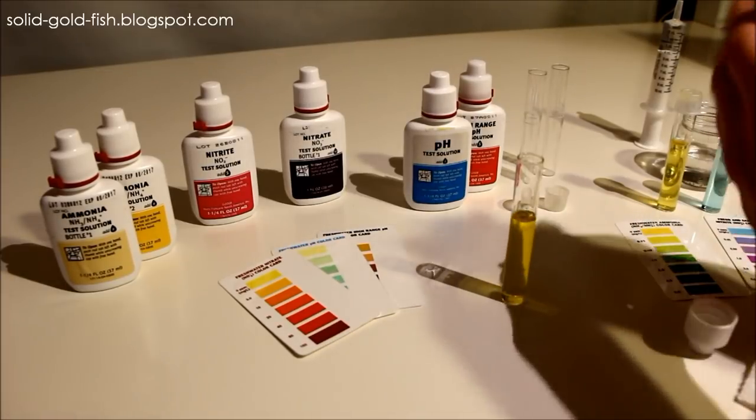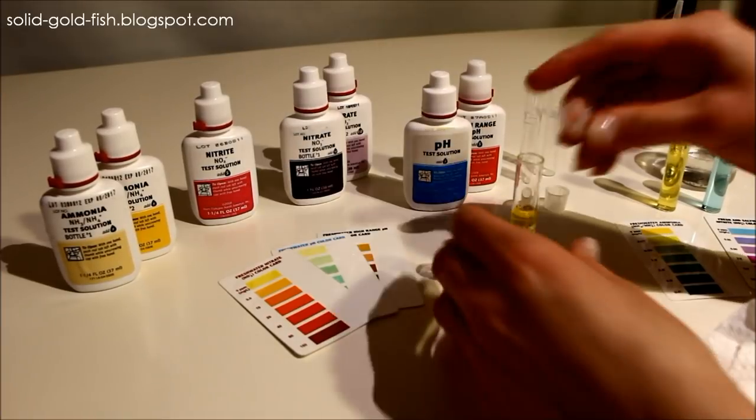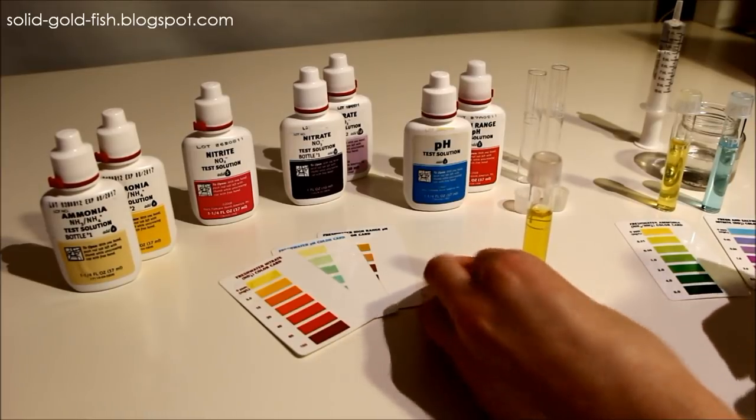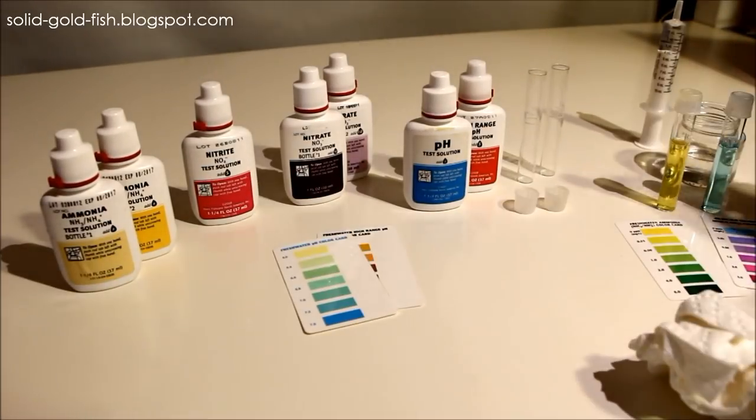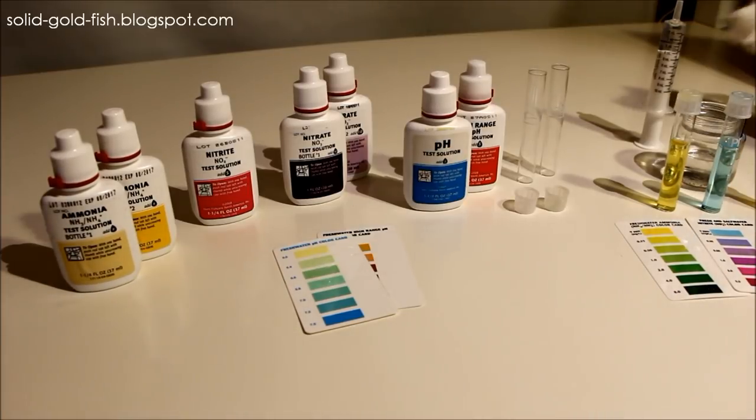Cap that and this one you have to shake for one full minute. When you're done shaking that, set that one aside as well with the others and now just the pH is left.